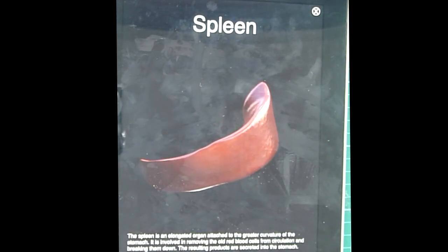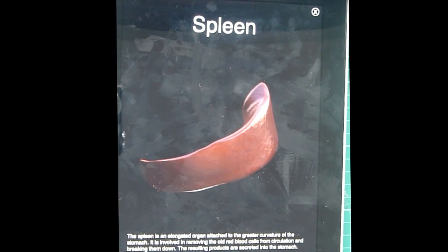The spleen is an elongated organ attached to the greater curvature of the stomach. It is involved in removing the old red blood cells from circulation and breaking them down. The resulting products are secreted into the stomach.